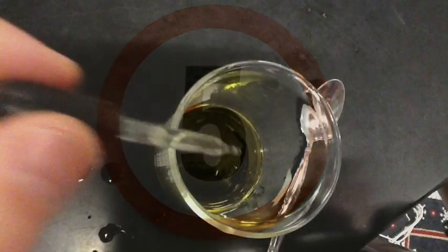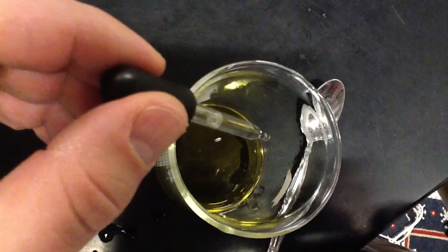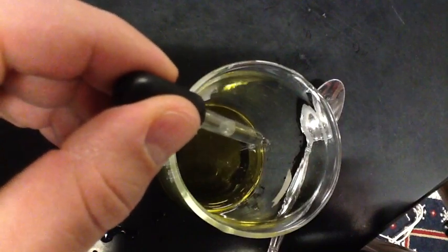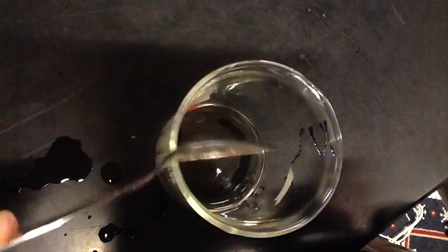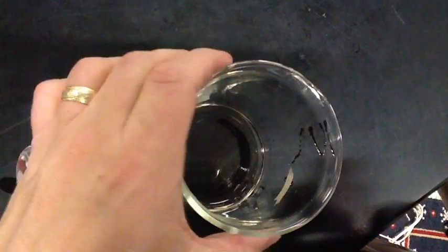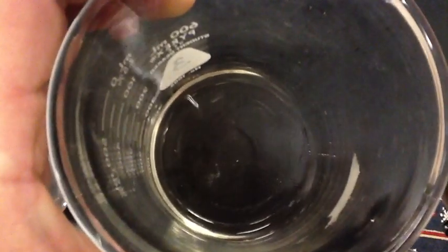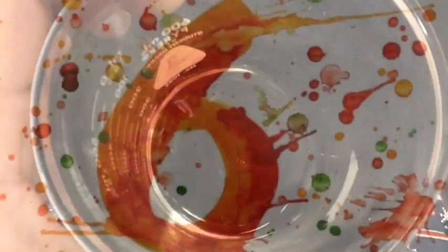Five drops. Here we go. One, two, three, four, five. Stir with a spoon. Physical or chemical?